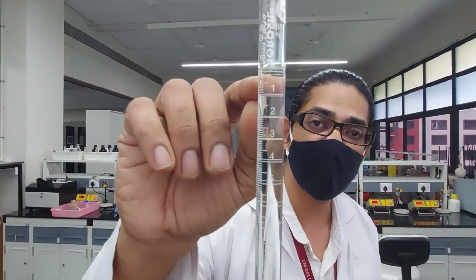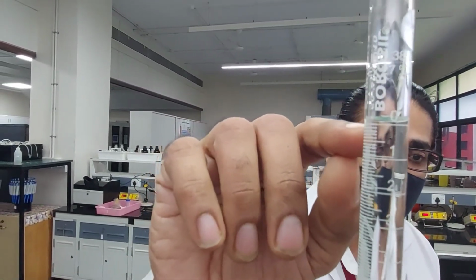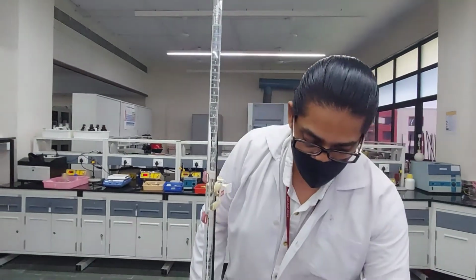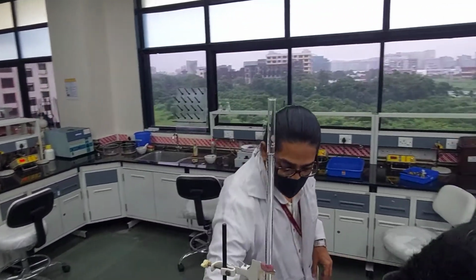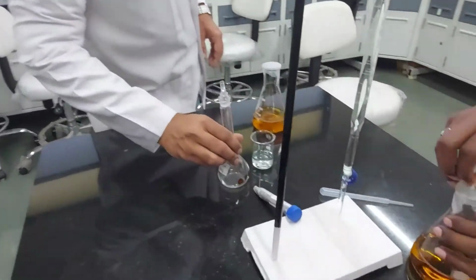Can you see the lower meniscus? It is right up here. It is fully filled, right? Now I can ask Mayuresh to carry on the titration over here. So he picks up the blank one. Rupesh, can you come on this side and focus on this one? The flask, I'll move this to make some space.